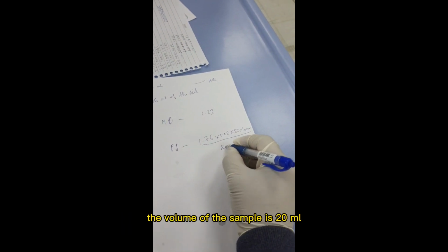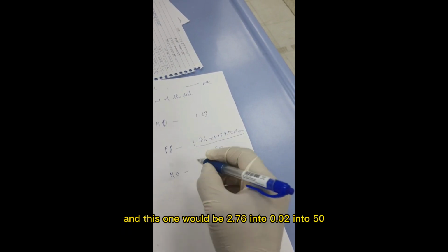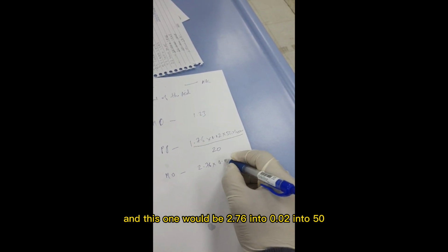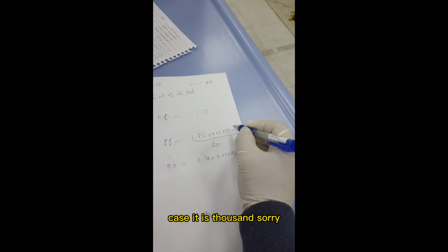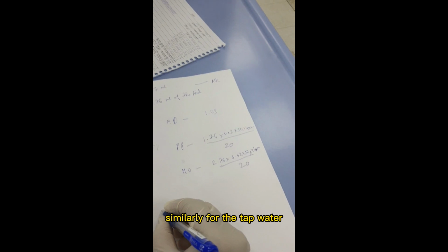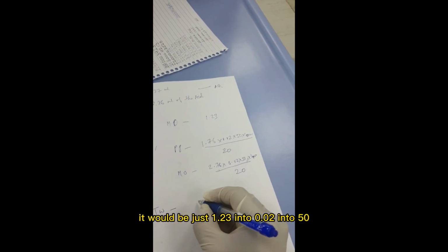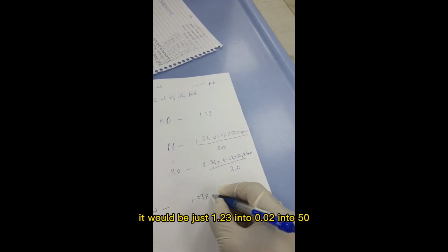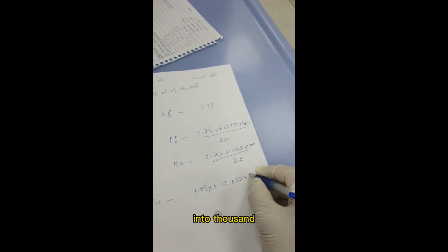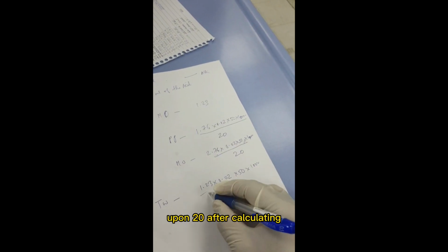The volume of the sample is 20 ml, and the methyl orange one would be 2.76 into 0.02 into 50 into 1000 upon 20.